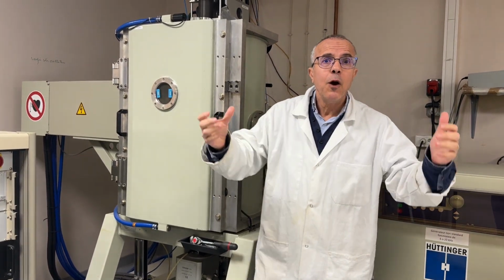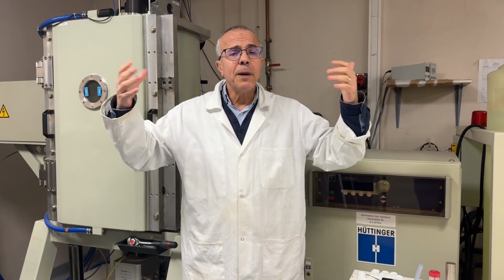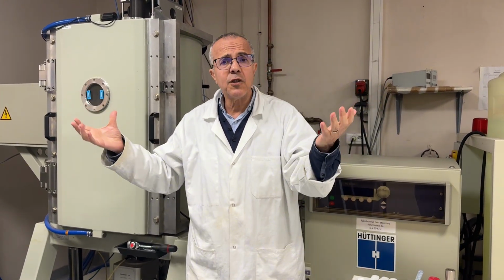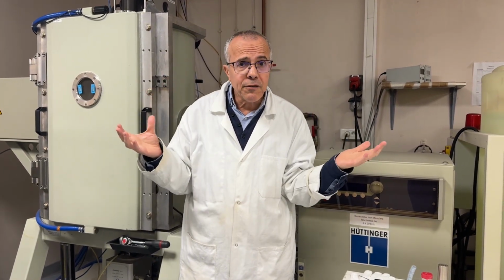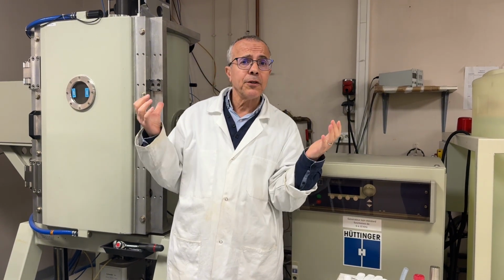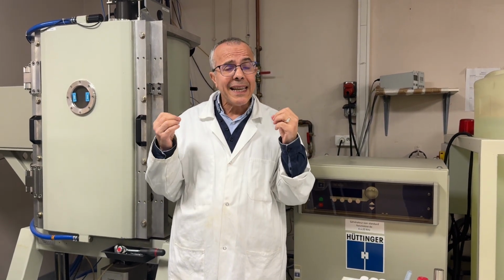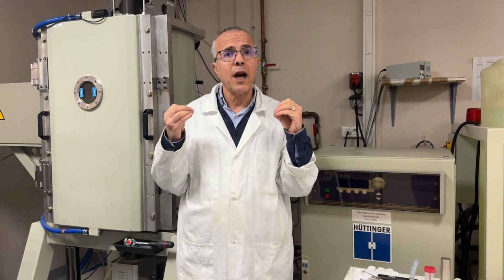crucible. As you know, when we grow crystal, we use a crucible, and the crucible can be distorted and oxidized, so we need to protect the crucible, and this is the reason why we need to work in a controlled atmosphere. Controlled atmosphere is like argon, nitrogen, argon-hydrogen. It depends on the application that we are working on, and it depends strongly on our needs and the performance that we are looking for.